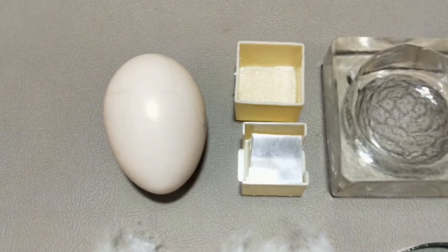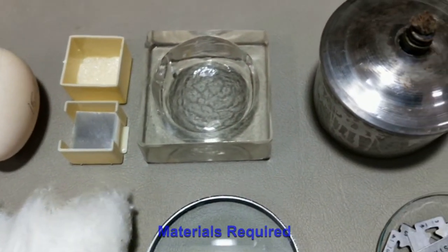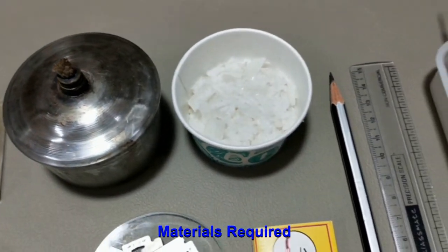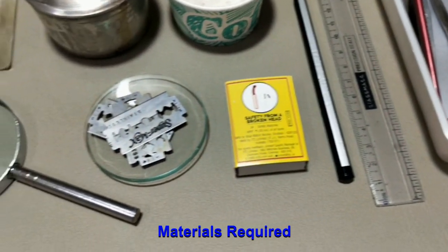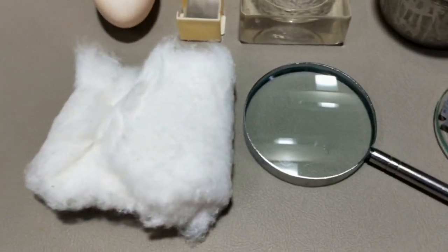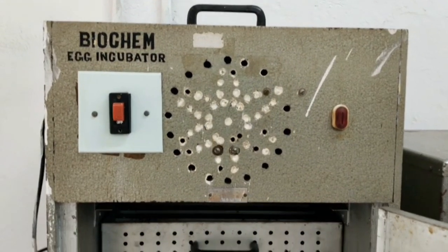Next, we shall list the materials required: fertilized egg, cover glass, embryo cup, spirit lamp, paraffin wax, pencil, scale, dissection set, matchbox, blade, hand lens, cotton, and egg incubator.